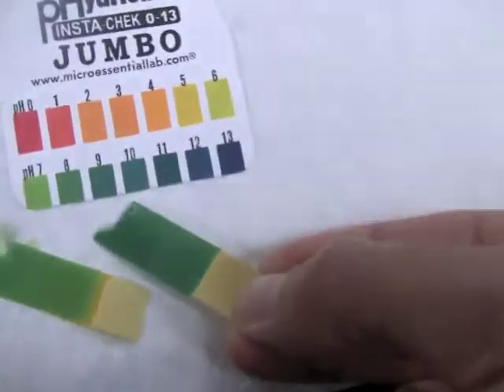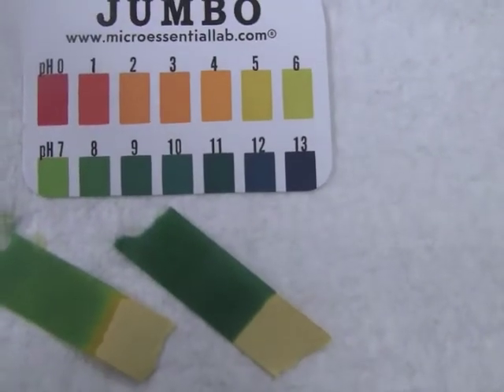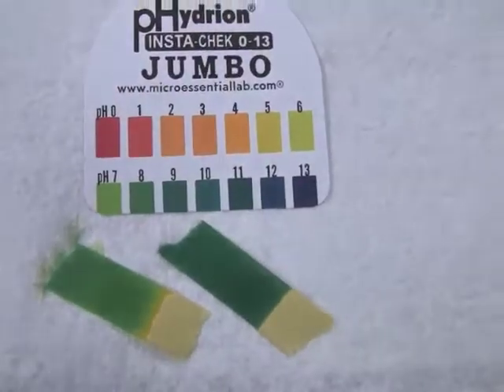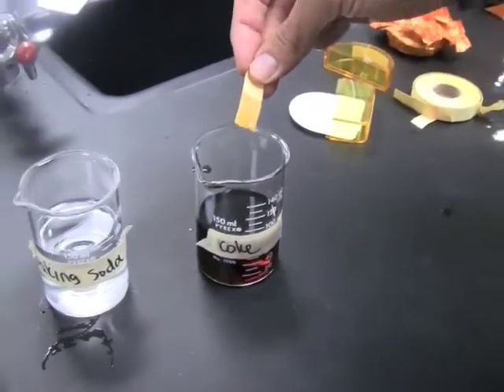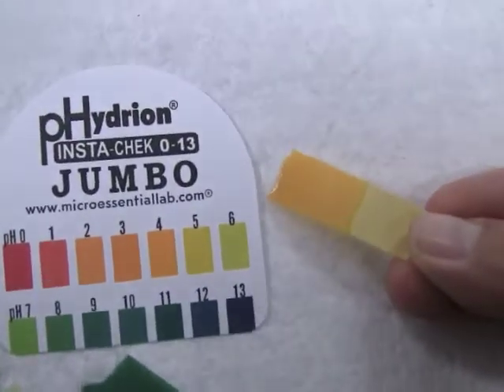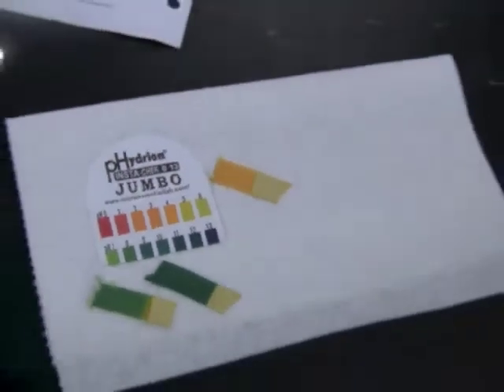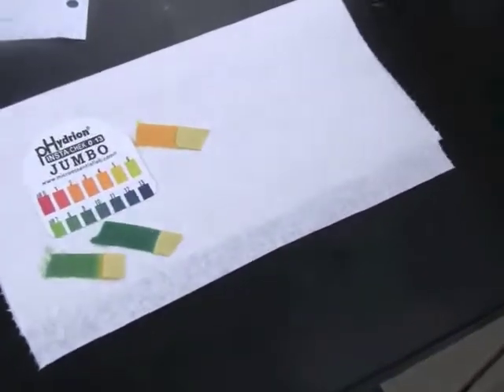If we set that over here, you can see we're moving up the pH scale a little more towards the basic end of the scale here, so we're probably at 9 or a 10, it would look like, in comparison and contrast rather to the pH of 7. And then finally the Coke. If we put that on the scale, we can see that we're more at a 4 or a 5, probably close to a 4 there. So pH, again, affected by the type of solute that you put into water, but standard water itself, neutral.